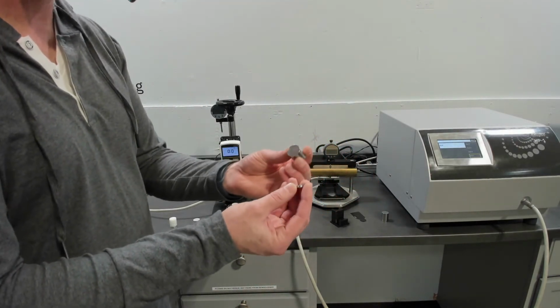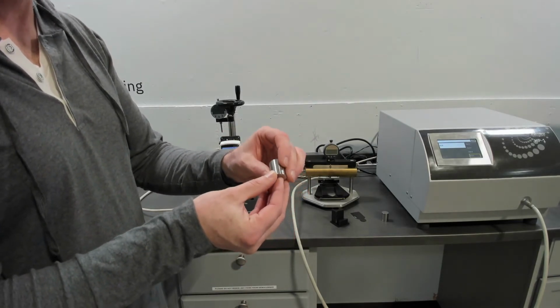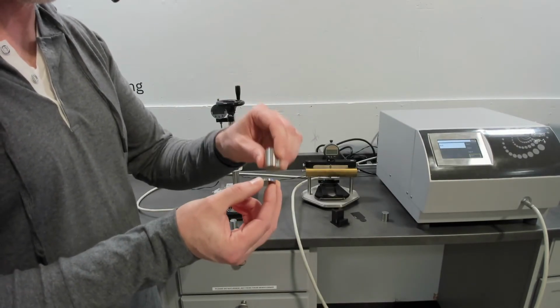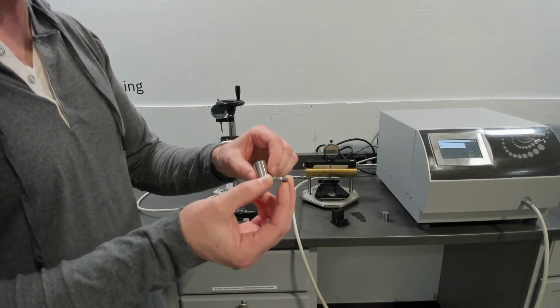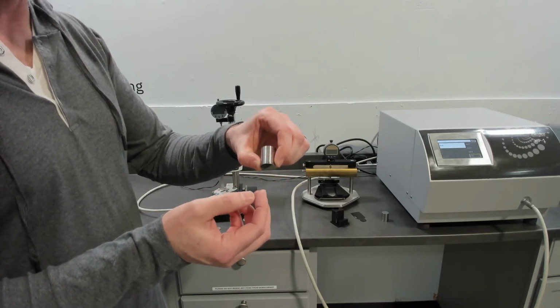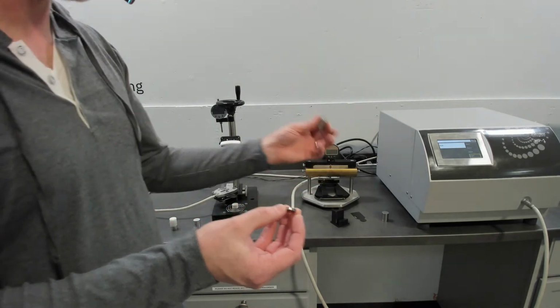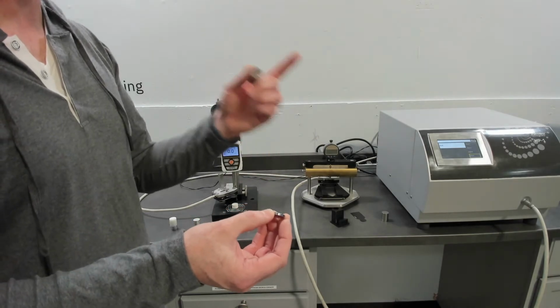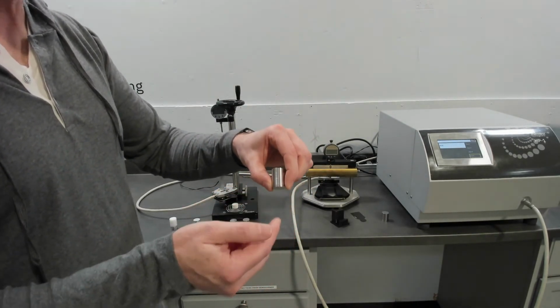materials, which are stainless steel, always with the same finish. What we're doing is measuring through primary, or piece A, into secondary, or piece B. Anything you introduce between primary and secondary, which are standardized materials, we measure the thermal resistance of. This is designed for adhesives, thermal interface materials, coatings, and freestanding films. Anything you introduce between these, you get the thermal resistance of.